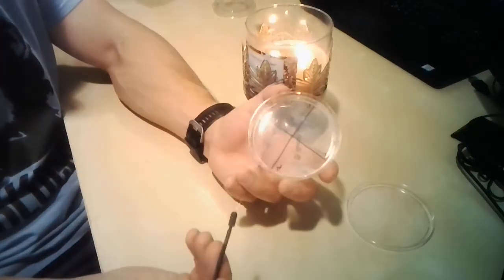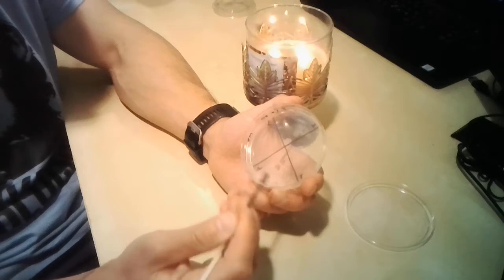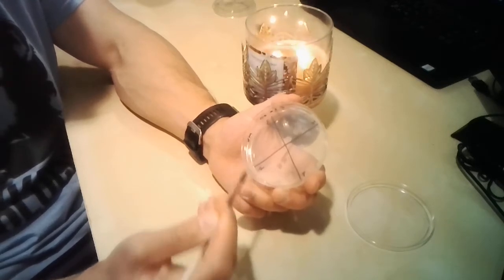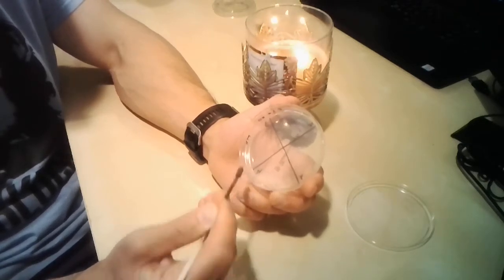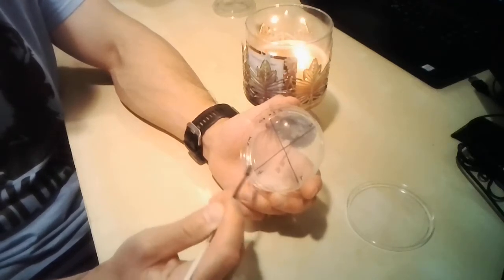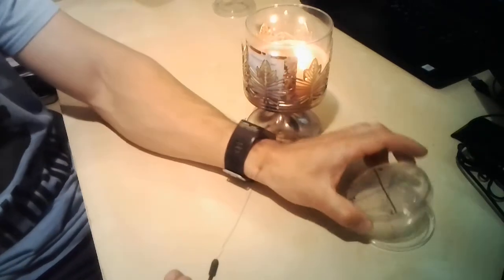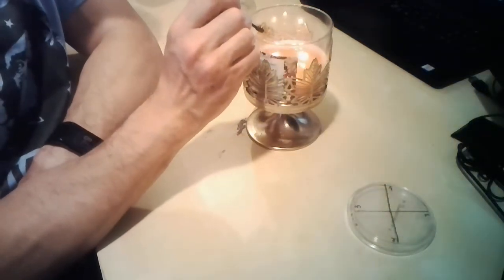Take a sample, like you grab a doorknob, and then I'm inoculating this area. For obvious reasons, I expect this area to produce much less growth because I didn't collect all microbes from fomite number 1. Now that I have inoculated, sterilize the loop again.